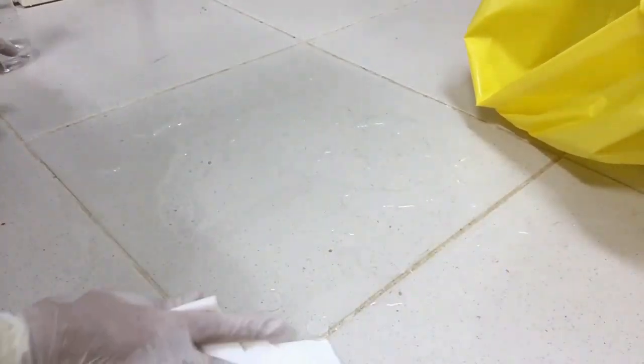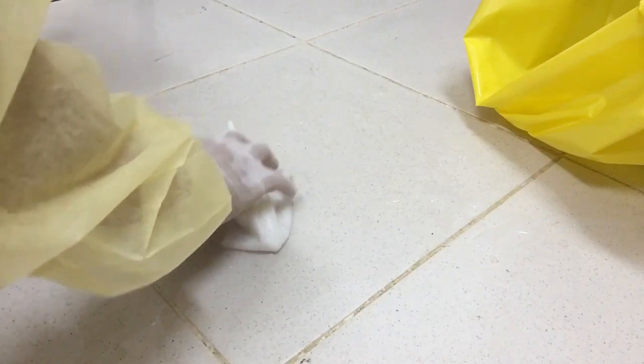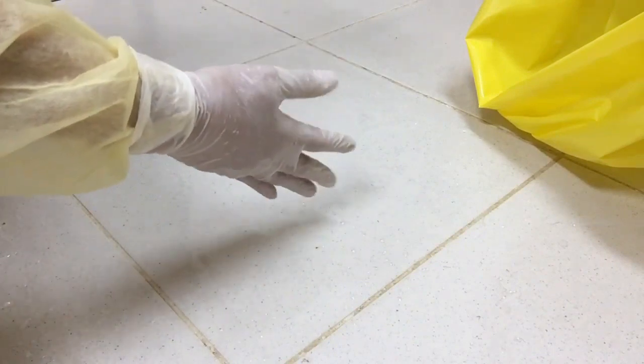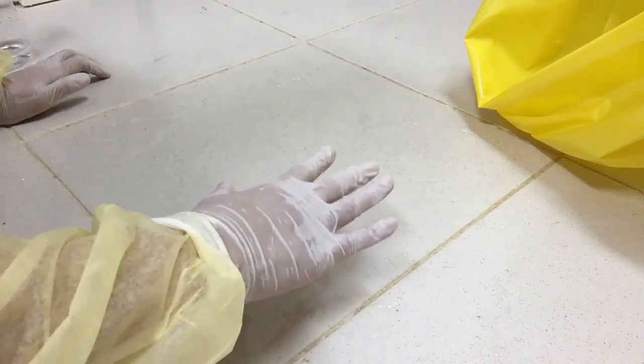It is already 10 minutes, so we have to wipe everything from outside to inside. We can now use the floor mop. These surfaces are safe from microorganisms. We can use the mop or call the cleaner.